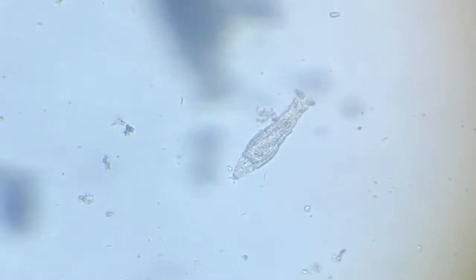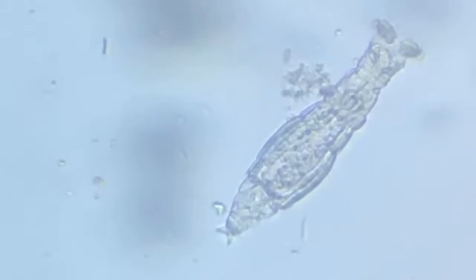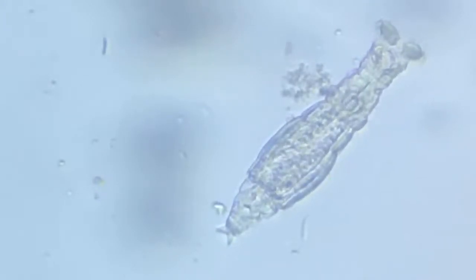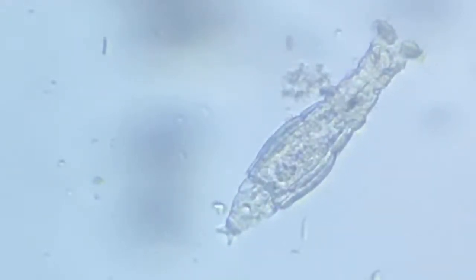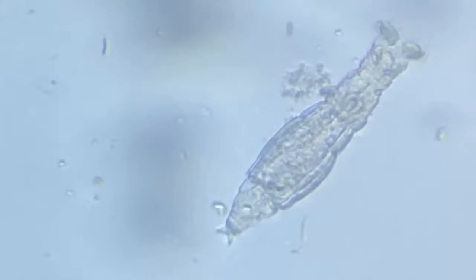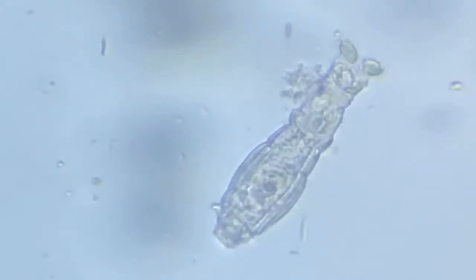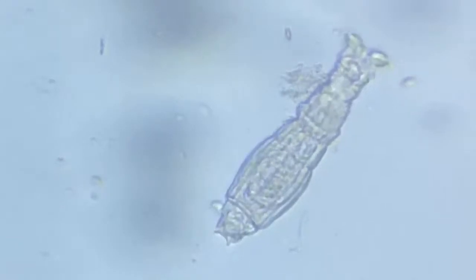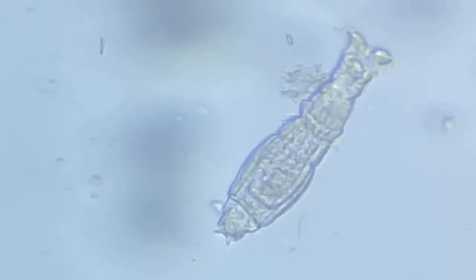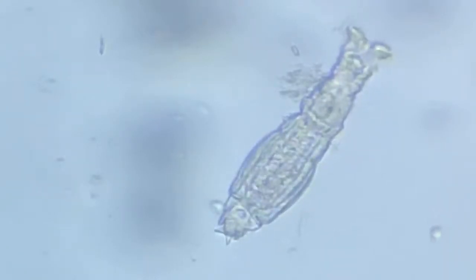And you can see there is a sort of movement in the stomach. You see there? Some slight degree of movement in the stomach. It's the mixing of food. Pretty interesting. Though not very sharp in focus, but still pretty focused.